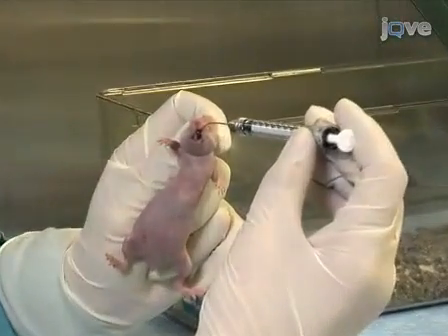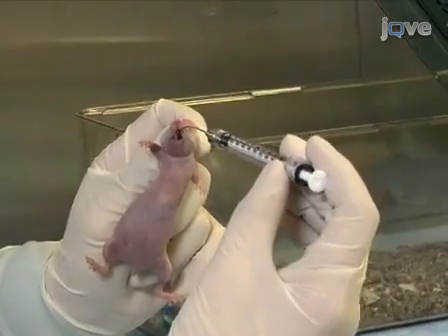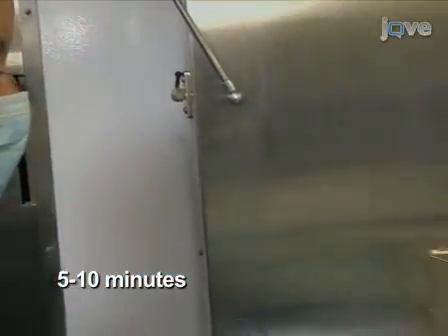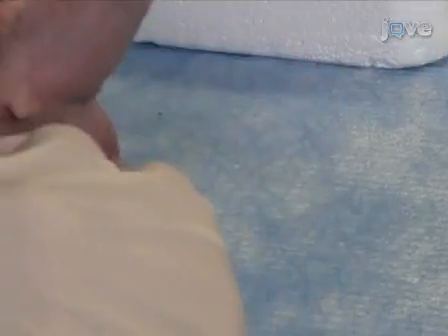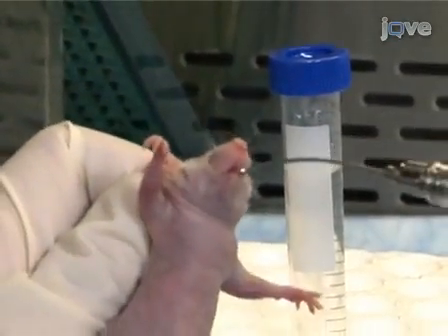Do not attempt to inject larger volumes than recommended, as this may result in reflux and incomplete drug delivery. Place the mouse back in its cage and monitor it for 5 to 10 minutes, paying close attention to any signs of laboured breathing, which may indicate that fluid has entered the lungs. Repeat this procedure as necessary. Up to 3 doses can be given in a 24-hour period.